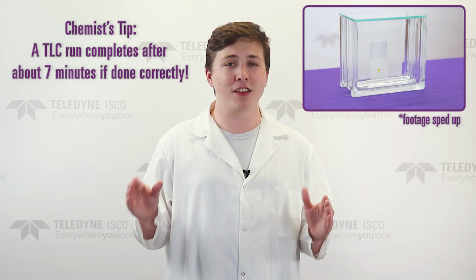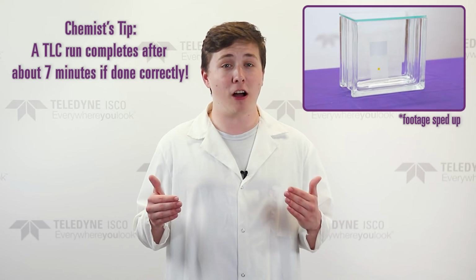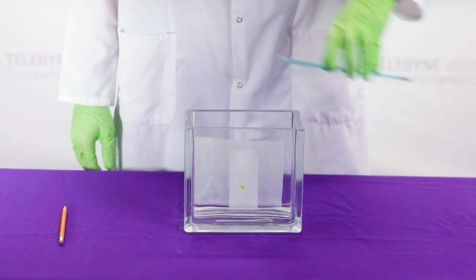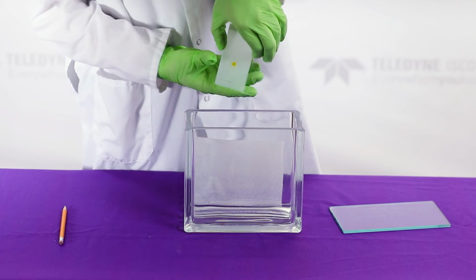If you follow the proper TLC method, in just 7 minutes, the solvent will climb all the way up the glass plate, and you will be able to analyze your compound. But remember, it may take longer if the developing chamber was not correctly equilibrated. Now that the TLC is complete, we will remove the glass plate from the developing chamber. With the pencil, we will mark the solvent front.